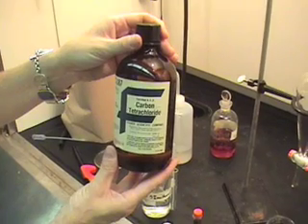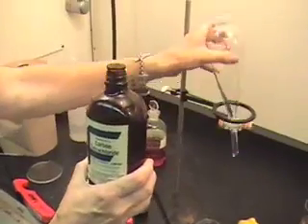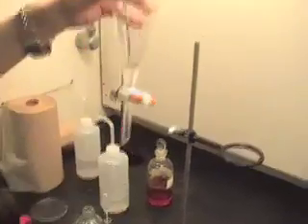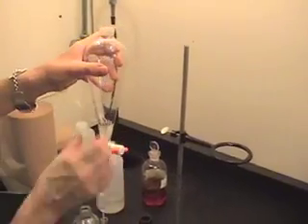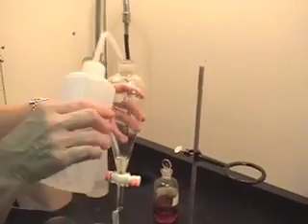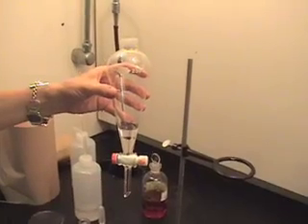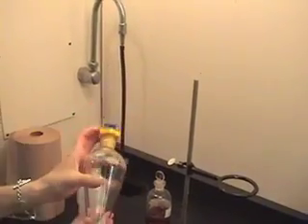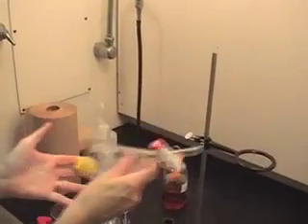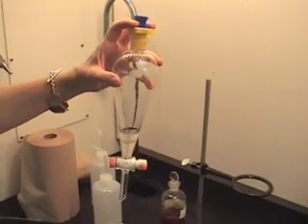A separatory funnel also separates things by physical processes. Here's a substance called carbon tetrachloride — it is a clear colorless liquid. Carbon tetrachloride is a compound like water, not a mixture, so it does not have variable composition. It always has one carbon and four chlorines. Now if I add water to it, we get a mixture. The question is whether it's going to be homogeneous or heterogeneous. You can see a little boundary — two phases. This looks like a heterogeneous mixture. I'll slosh it around to see if it dissolves, but no — it's separating back out into two layers, just like oil and water.